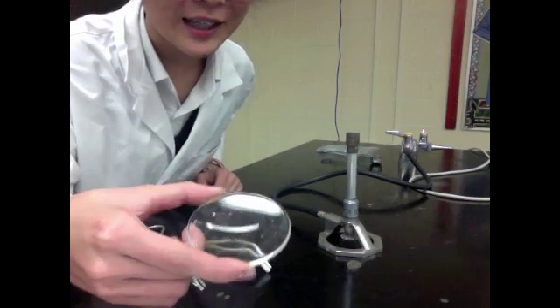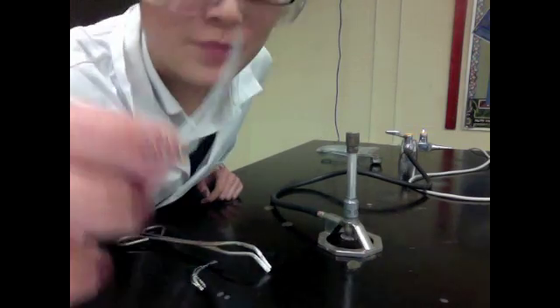Okay. So here's the magnesium ribbon that the teacher will have prepared for you. It looks like this, just a small little piece of magnesium.